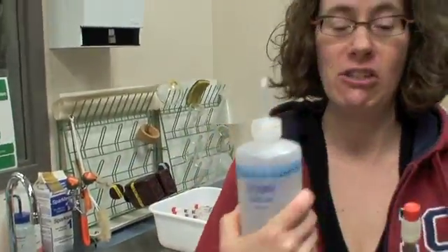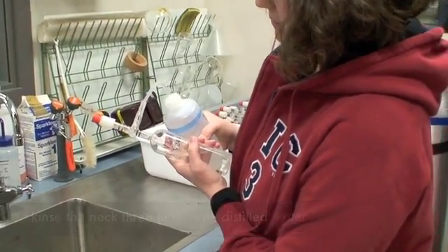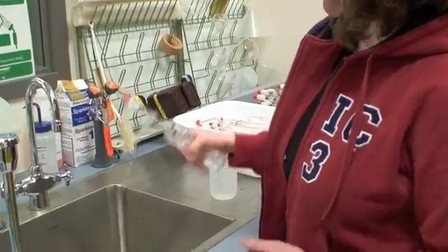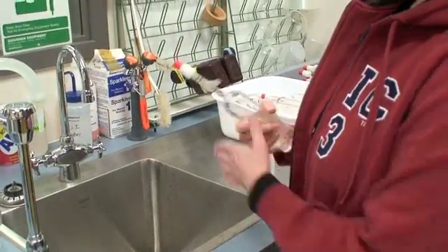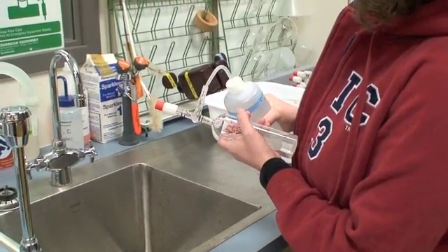Shake the water out. With a squirt bottle of distilled water, we're just going to fill that area up. Knock it against the heel of your hand to distribute the water. Do this a couple of times, shake the water back out.